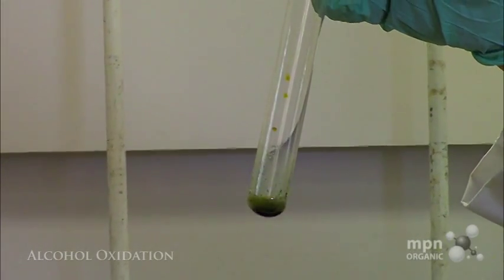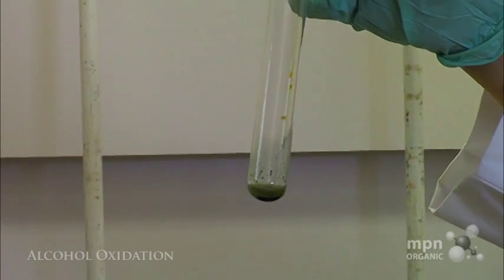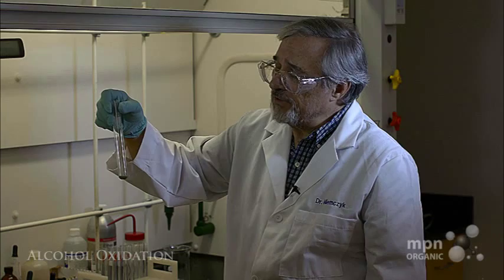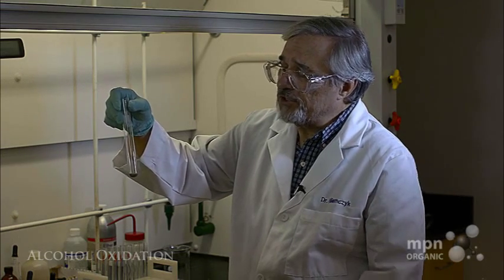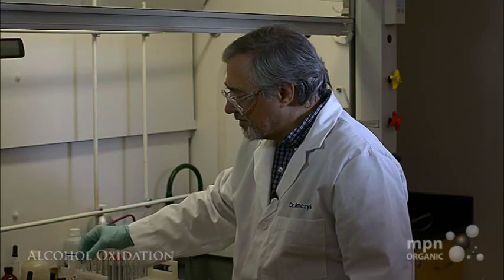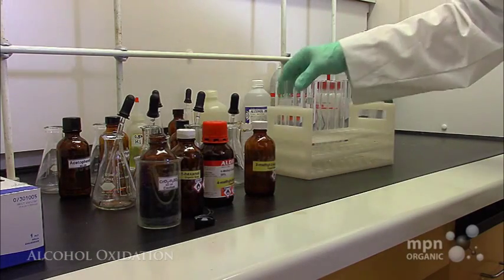But very clearly the primary alcohol reacted very swiftly to give us the oxidation product and reduction indicated by the +3 oxidation state of chromium. Okay, so that's the first one. Let's look at the second one.